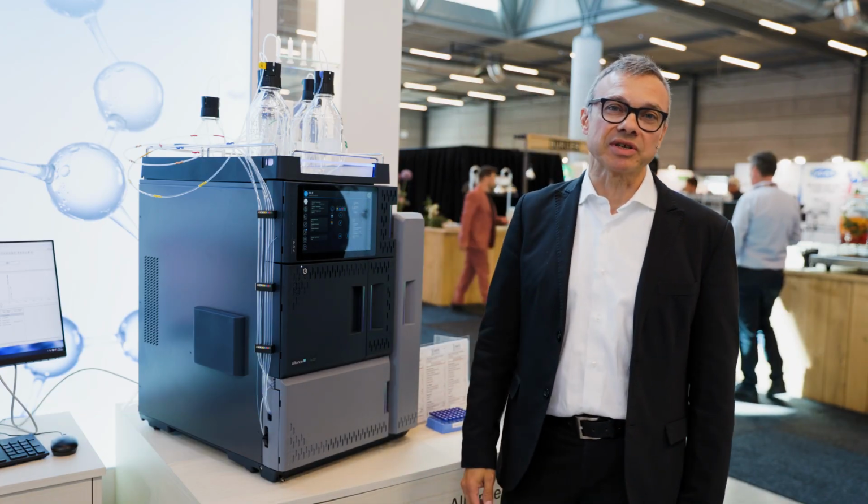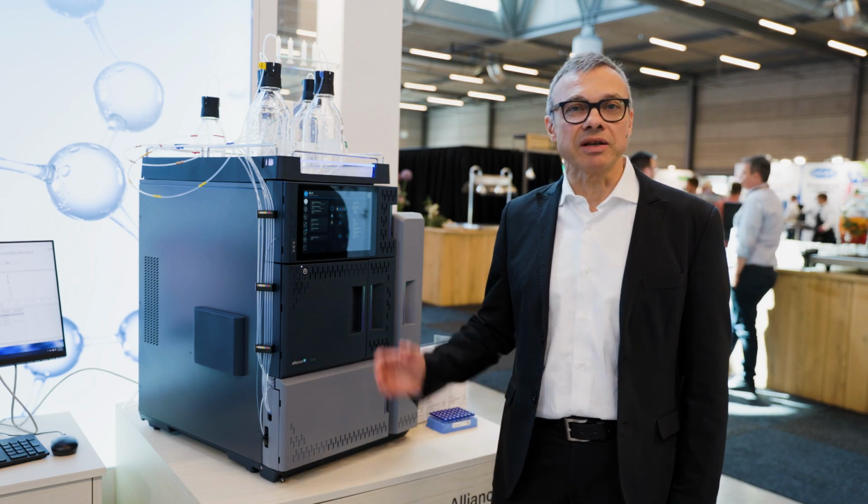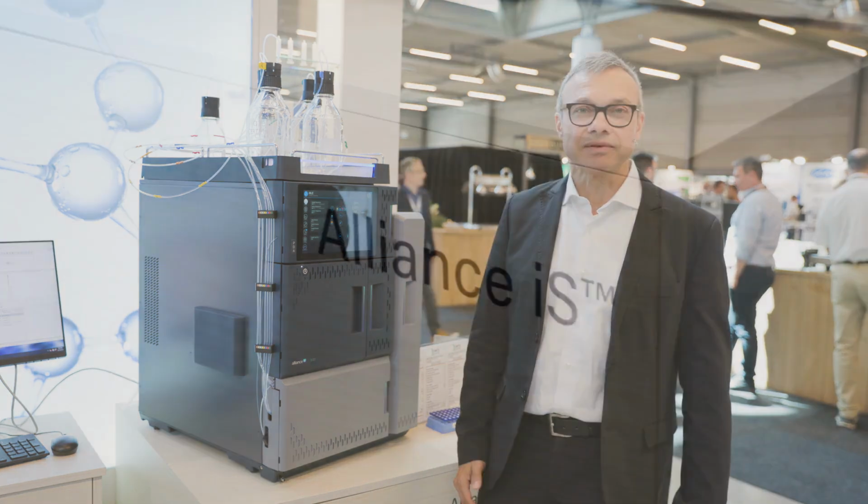I'm the LC Market Development Manager, and I'm here to show you the latest system designed for QC labs to reduce errors and deviations and out-of-spec results. So let's see how it works.